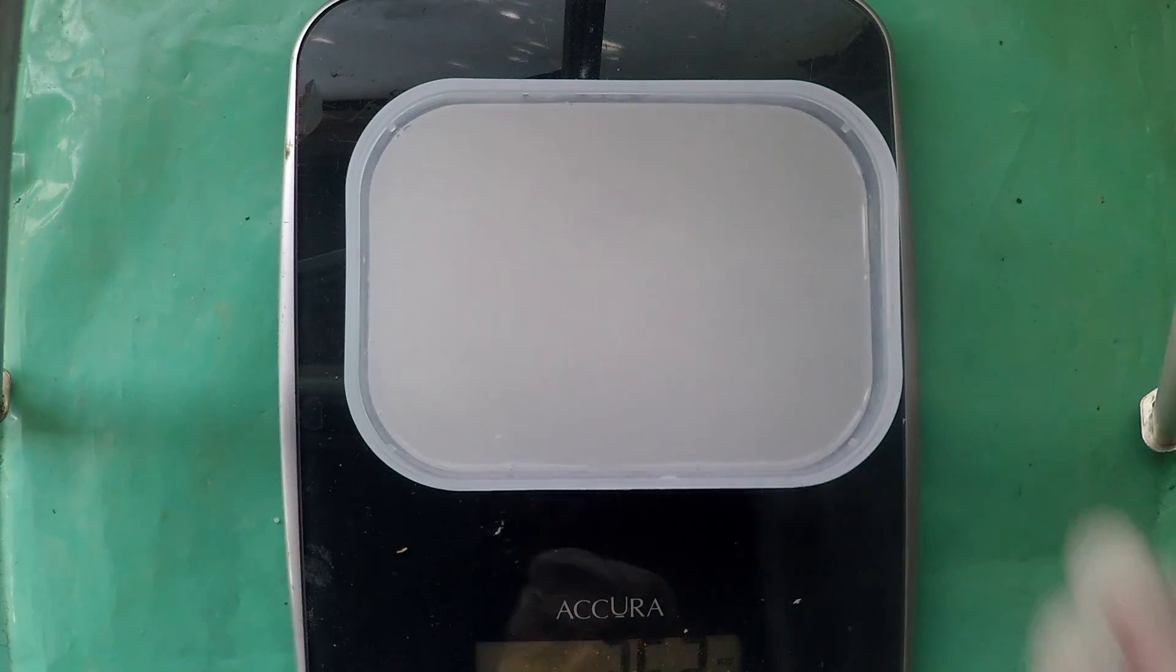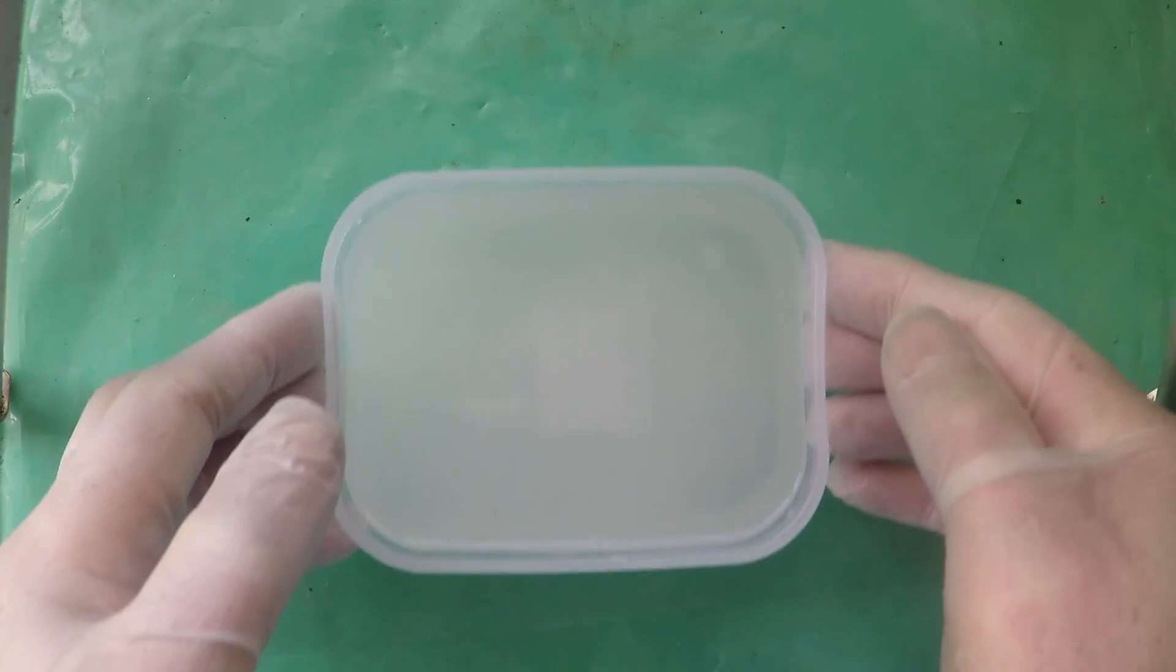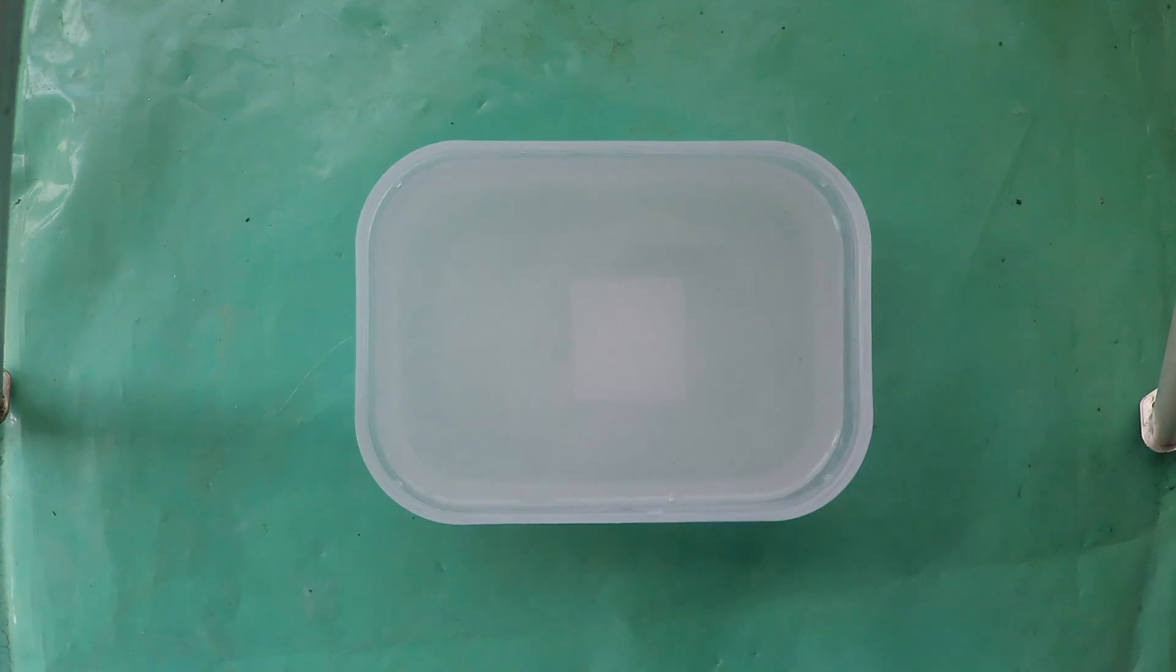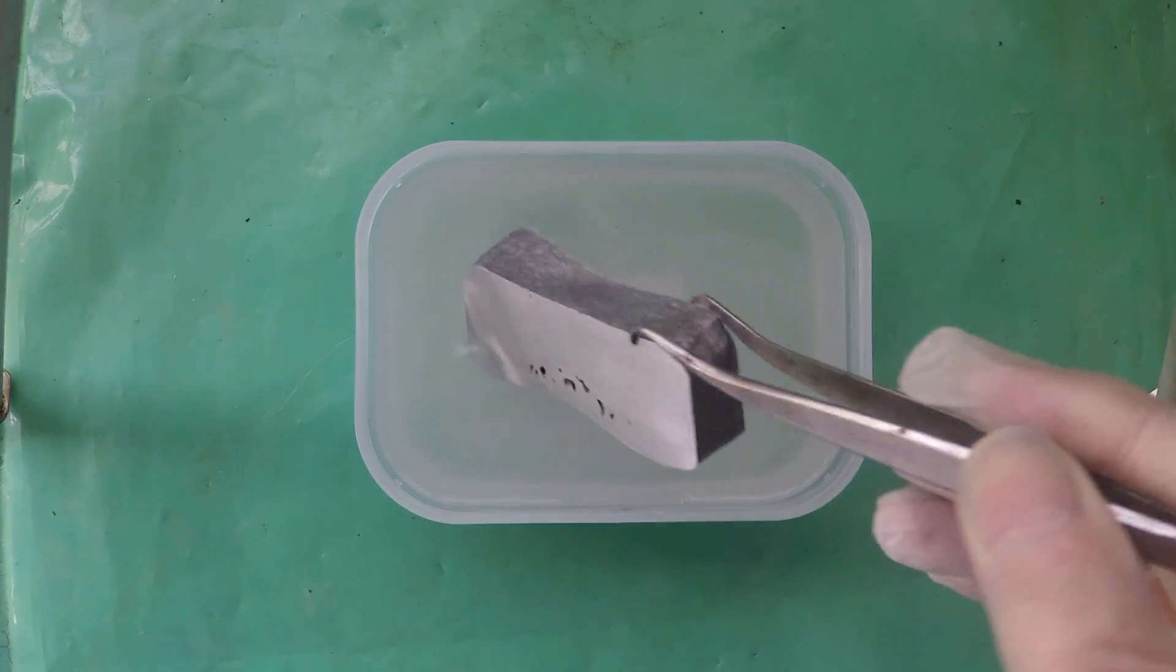Okay. That's probably not too bad. I will remove the scales. That's quite warm. It has as I suspected picked up a bit of heat and the spray I can feel it in the air getting at me a bit.